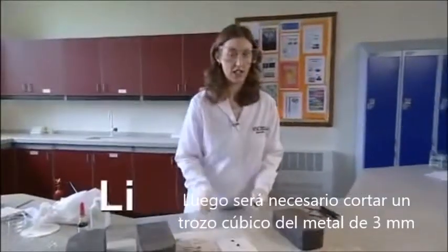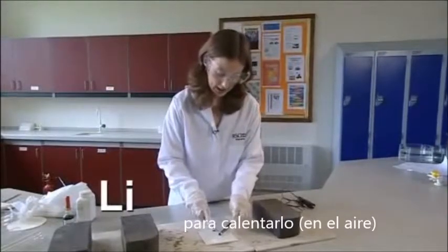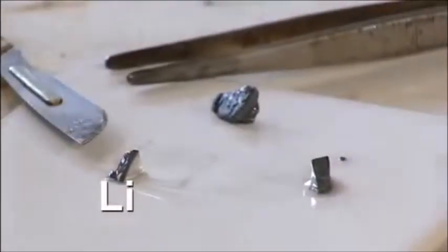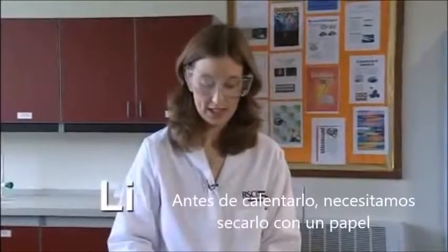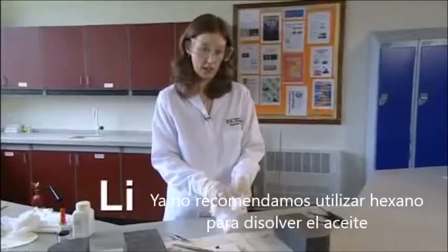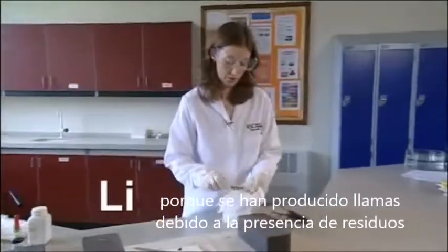Next, you will need to cut a 3mm cube piece of metal in order to heat in air. Before we heat in air, you need to dry off the oil from the metal using some paper tissue. We no longer recommend using hexane to dissolve the oil because there have been fires when washing up due to some residues.